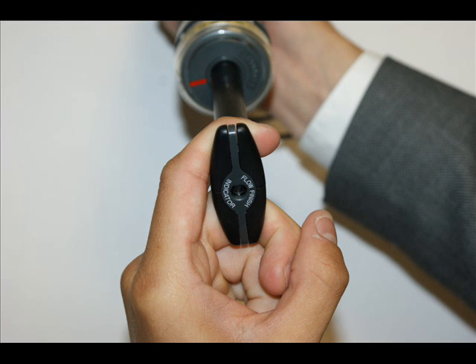Then wait for 2 to 3 minutes. After this time the flow finish indicator should not illuminate. If this is the case, your pump is fully leak-tight and ready for use.